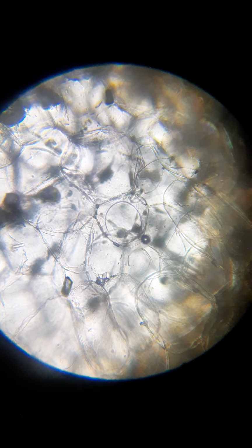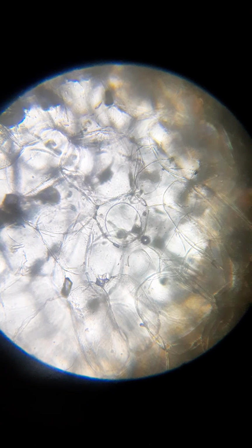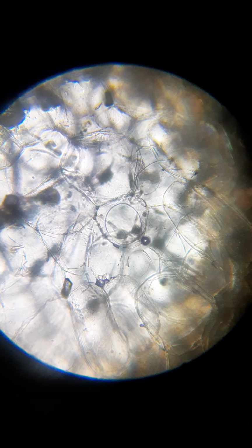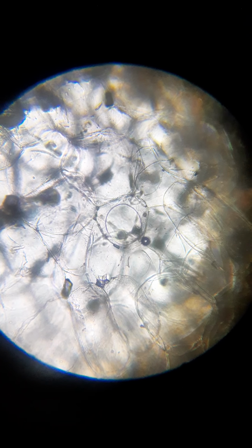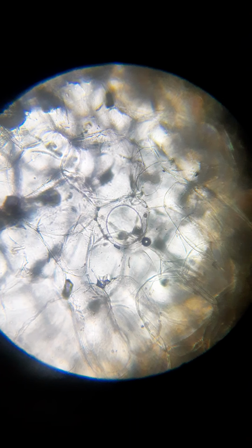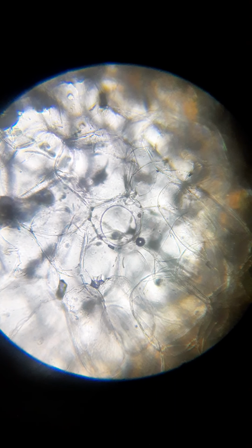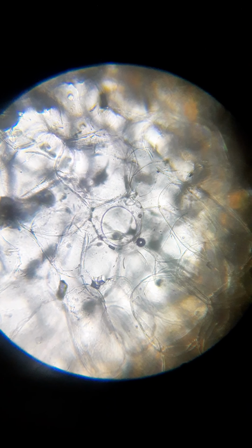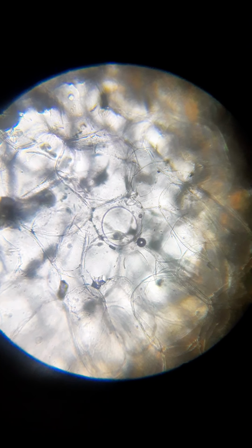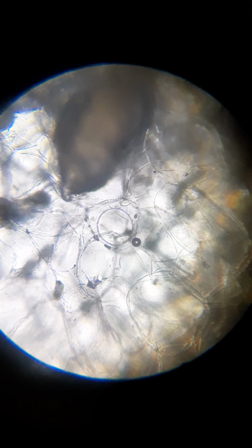Okay, it's going to be kind of interesting, I'm going to see if I can make a pointer with a hair, not a follicle, but just a hair. Where is it? And point at this. It's kind of funny. Oh, you saw it pass. Right there.